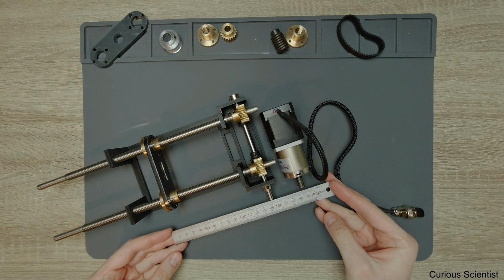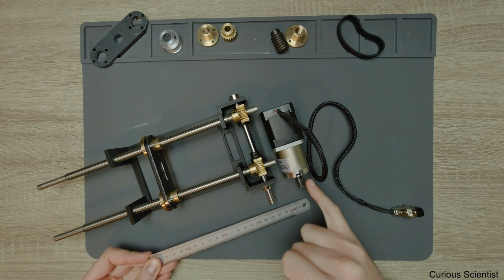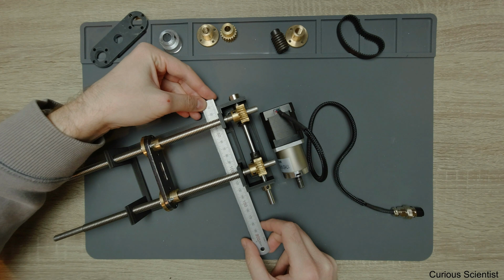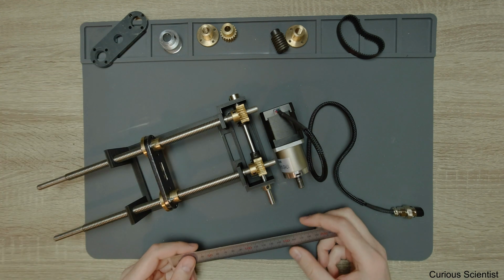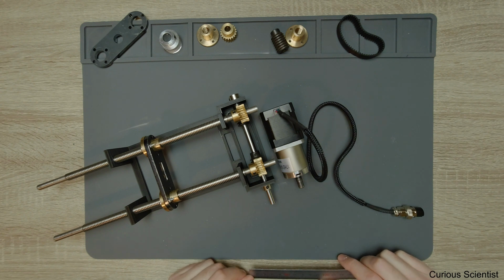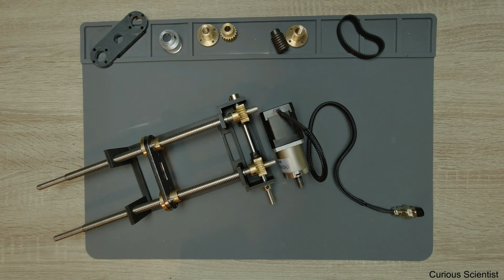So if I see, it's roughly like 25 centimeters in this length, and the width will be like 16 centimeters. So it can be fitted on an A4 paper, more or less, except the electronics and everything else. But the main structure which will do the job is small enough to squeeze it like this.